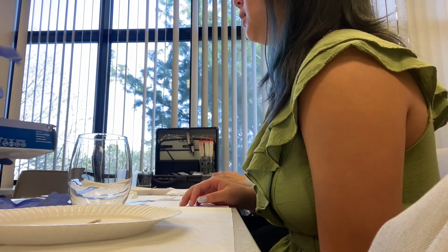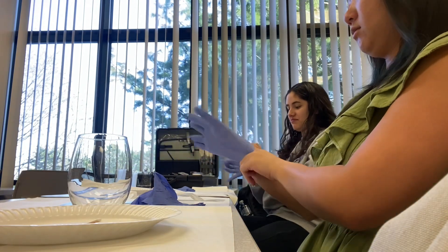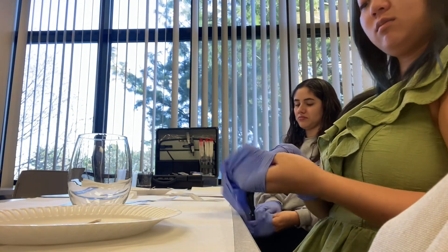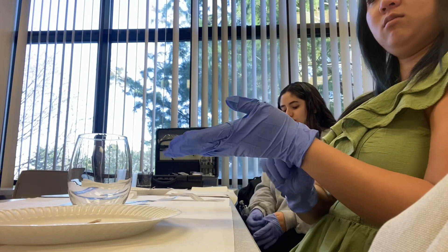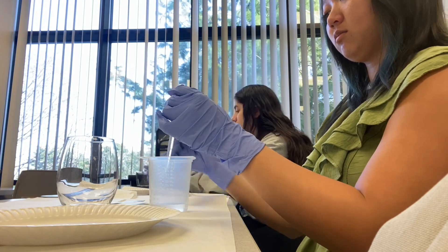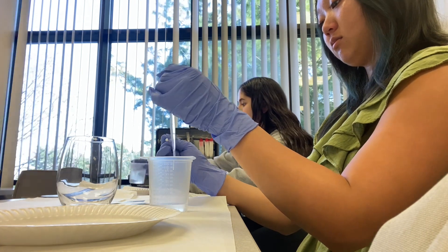So, you've already taken pictures of your cup there. Now the first thing we want to do would be to photograph that cup, right? Always photograph prior. So let's say you've got your pictures. Now you're going to do your DNA — with your beaker, a little bit, a couple drops on your DNA swab. And you're going to seal it in the envelope, and you're going to use your evidence tape.